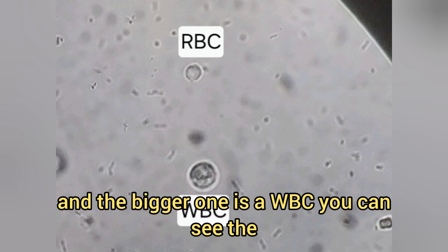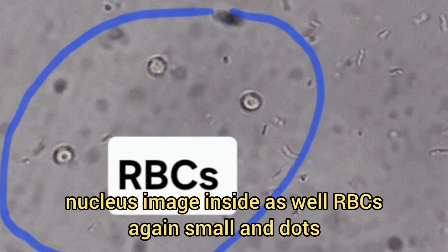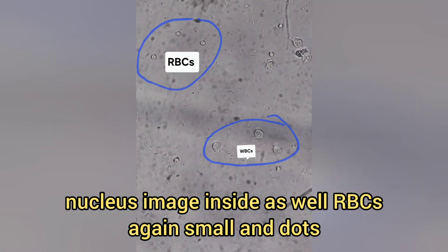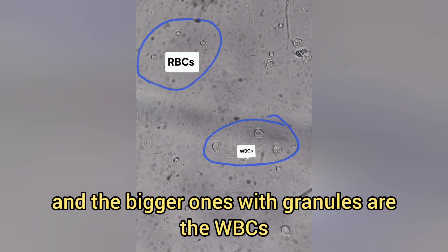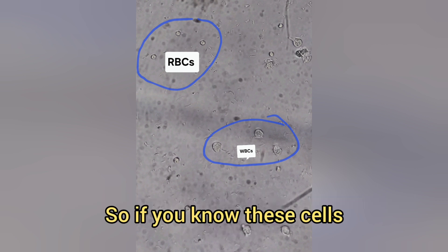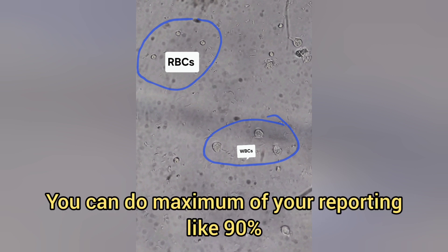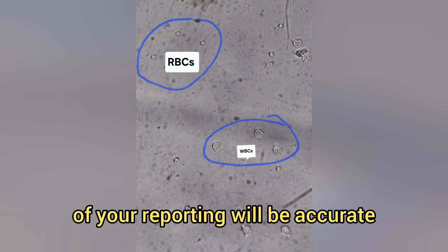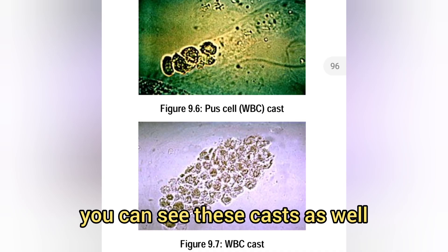RBCs are again small with dots, and the bigger ones with granules are the WBCs. If you know these cells, you can do the maximum of your reporting — around 90% of your reporting will be accurate. You can see casts as well.